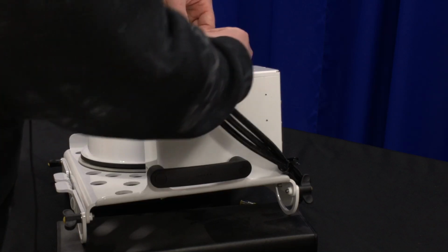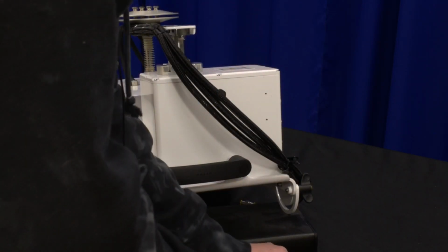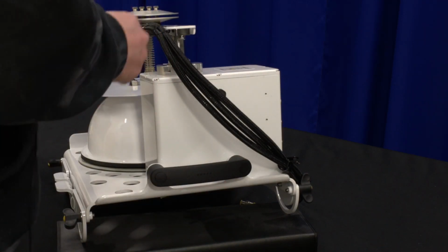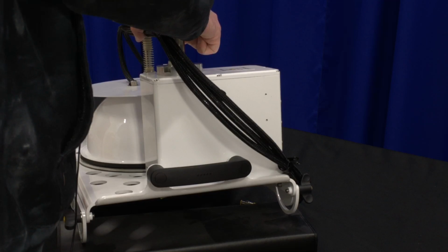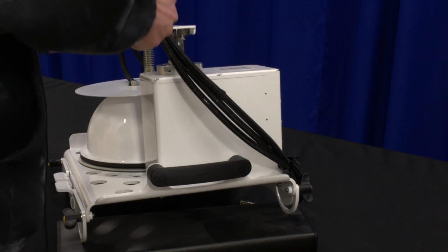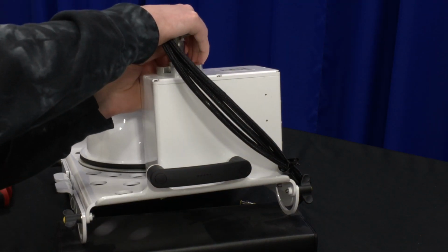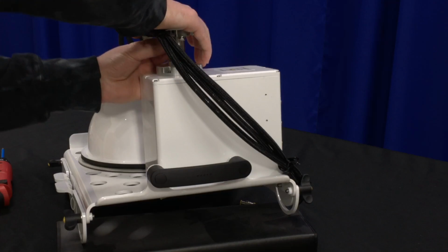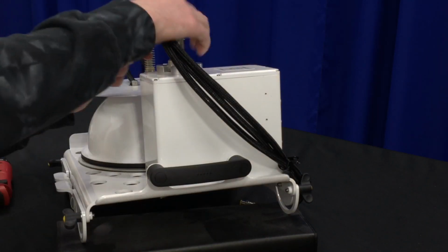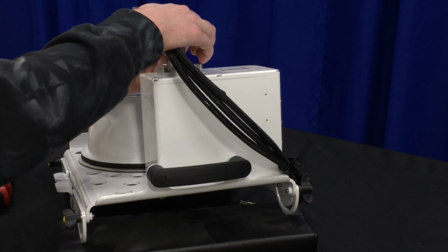We'll start by finger tightening. And then you will want the bowl to line up slightly towards open as you try to get it in place. Now that they're finger tight, we'll line up the bowl and use the wrench. It needs to be tight, but there's no need to crank on it.